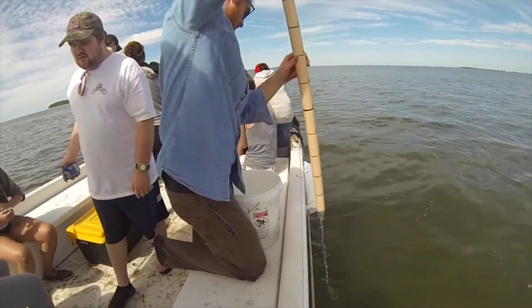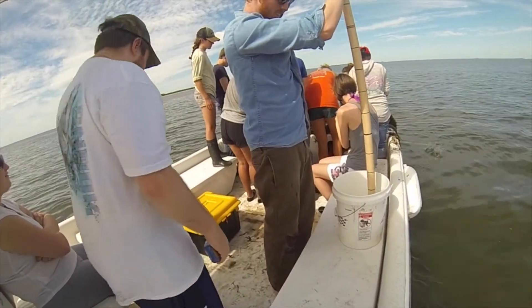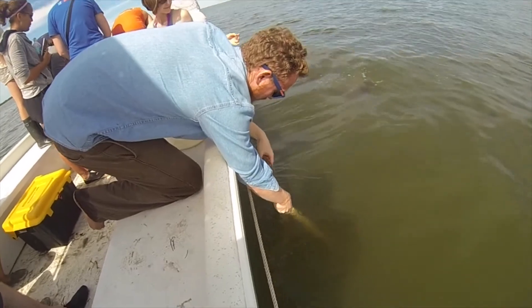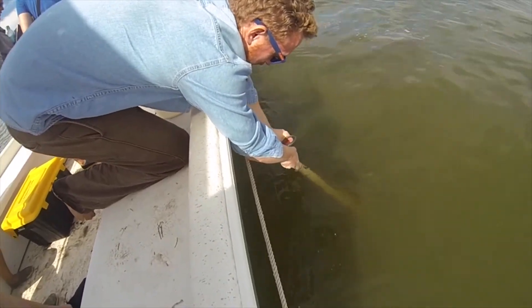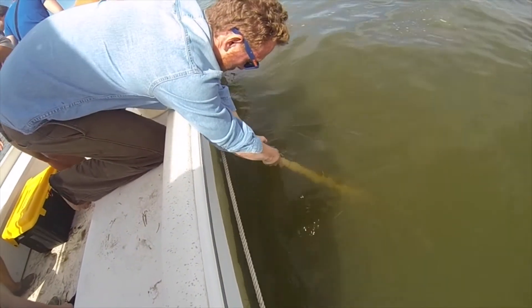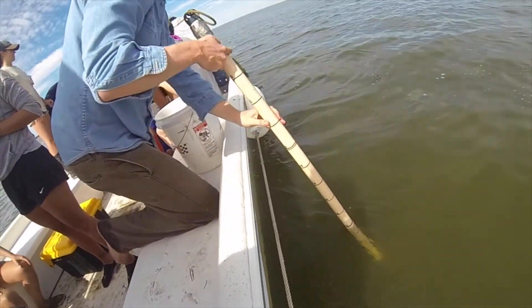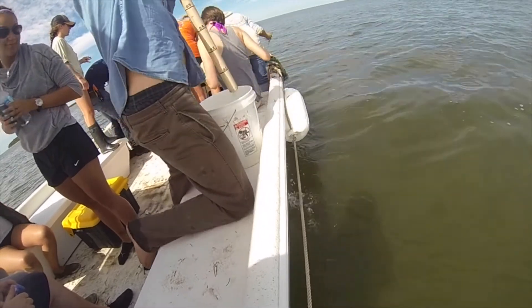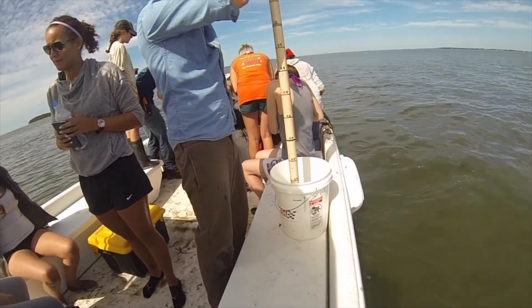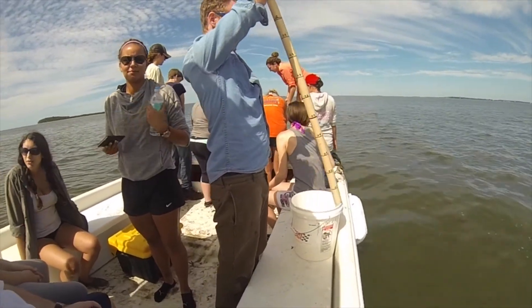This ensures that water doesn't come out of the bottom of the pole until the top is uncorked. This sampler ranges in size depending on what depth you are collecting your samples from. For the purpose of our experiment, we used one that was 1.5 meters long. A bucket is also needed to put the water in as you are collecting it. We did five grabs with the integrated pole to ensure that we collected a representative sample of the photic zone.